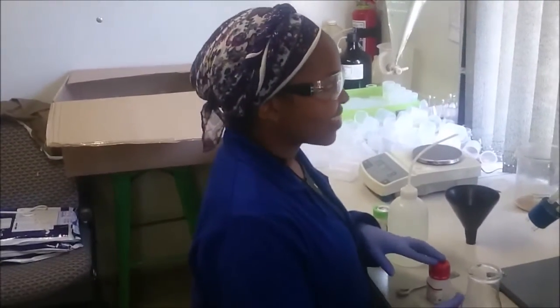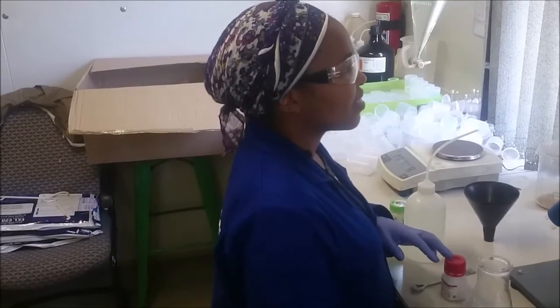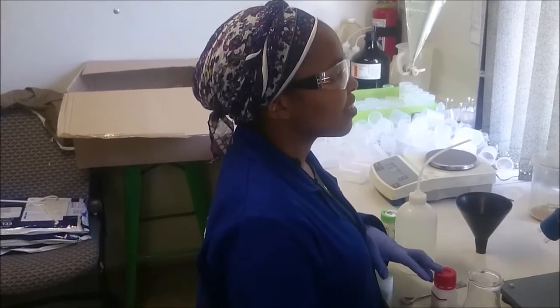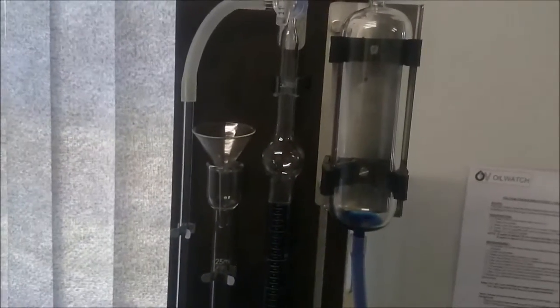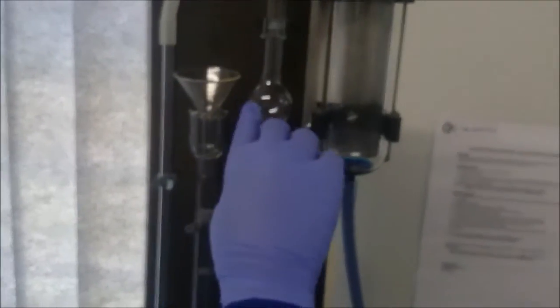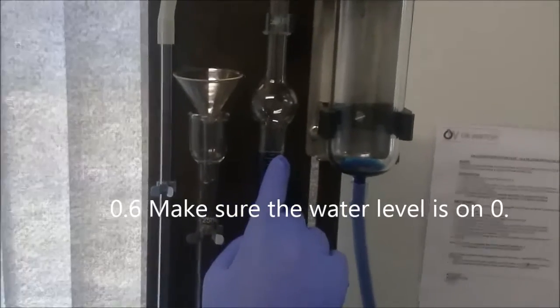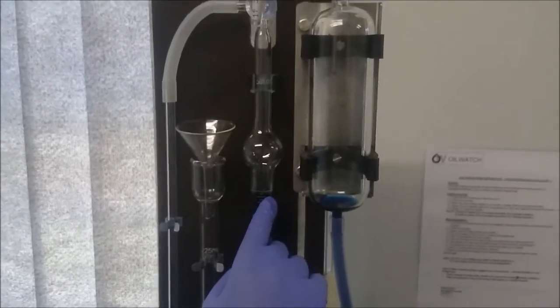First things up, we're going to have a look at the apparatus and just describe the various parts. This is the water burette. At the beginning of the test, the water must be zero.